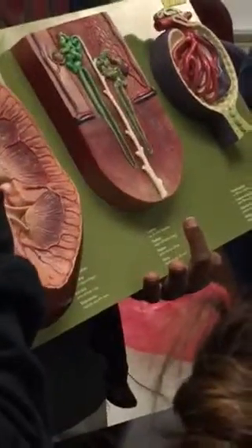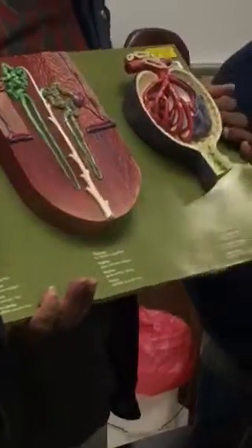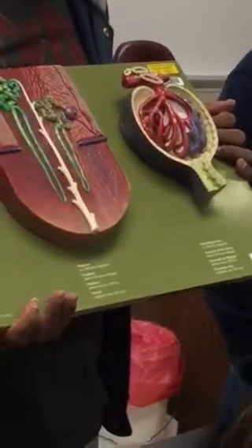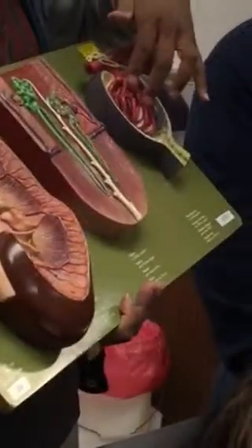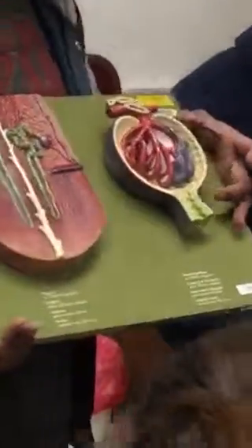Alright, so renal corpuscle. Okay, let's just go to the big piece here. Renal corpuscle has different parts to it. So what does it say there? Glomerulus is the red on the inside. The red color on the inside is the glomerulus for the renal corpuscle. And then the blue on the outside is the Bowman's capsule. Capsule on the outside, all around.